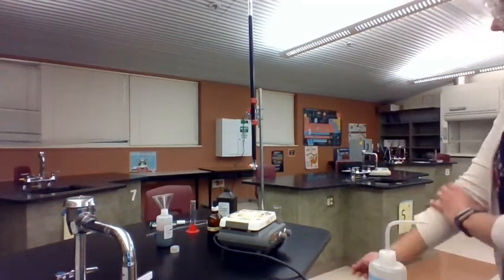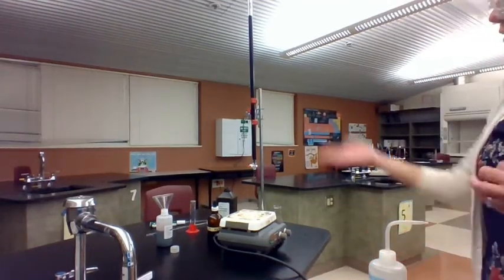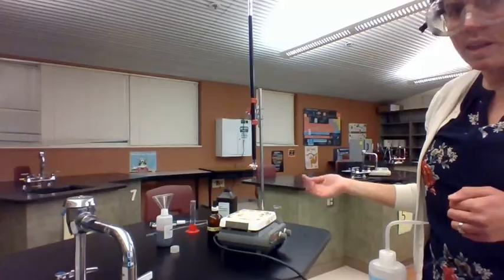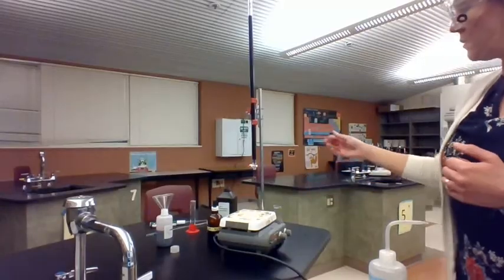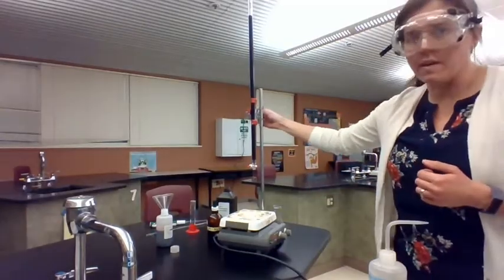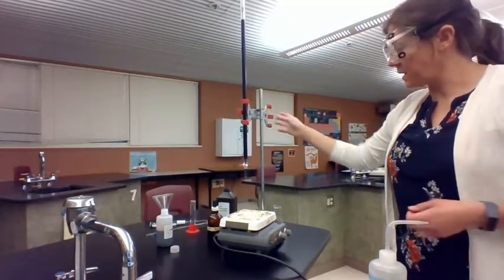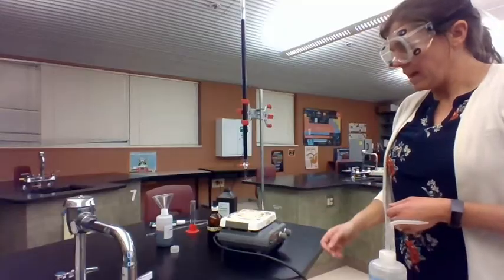All right, welcome. In this lab, we are going to be performing a titration, and this is going to be an example of a redox titration, as opposed to an acid-base titration.